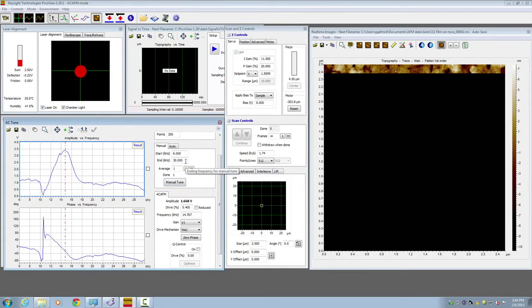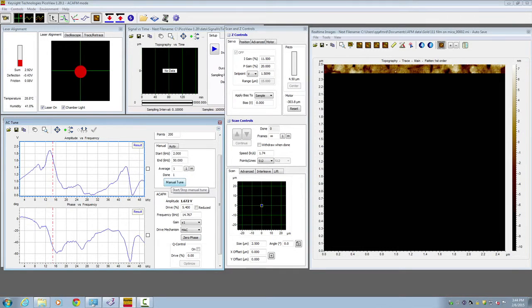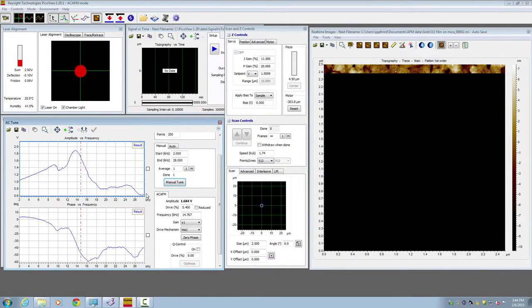Here in the manual tune, we choose from 2 kHz to 50 kHz and click manual tune. Let's narrow down this tuning from 2 kHz to 28 kHz. Again, remember, in liquid imaging, you cannot use automatic tune. You have to use manual tune. Here we identify a peak around 14 kHz. We will adjust the driving frequency on the peak of the resonant frequency of this cantilever.